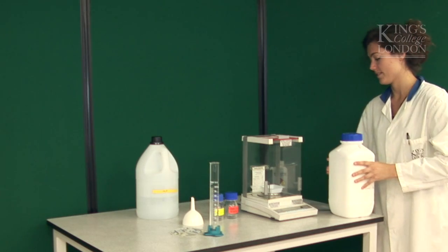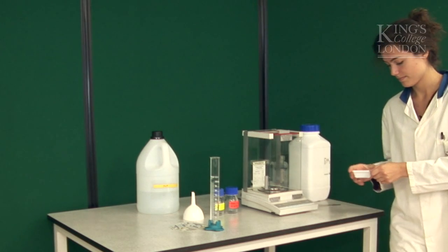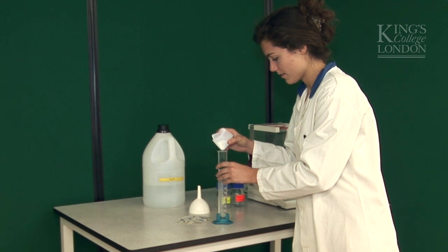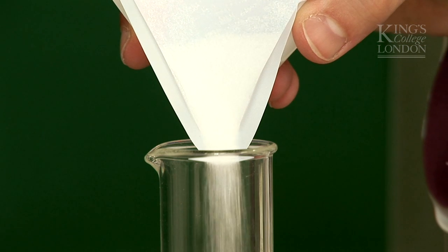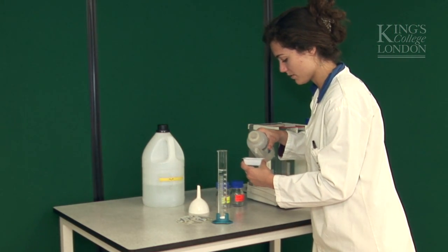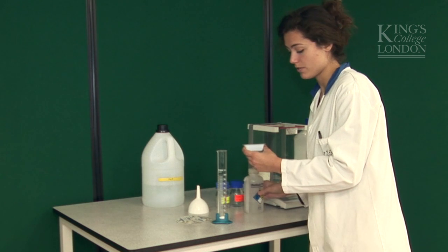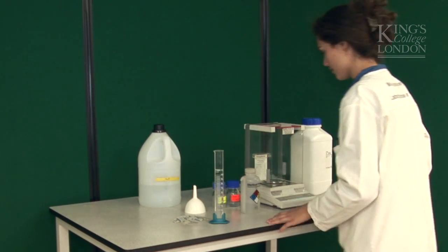Let's now put them in the measuring cylinder. Then it's usually a good thing to wash the walls of the weighing boat with some water to collect all the grains of powder — in this case sodium chloride — so as not to lose our precious powder.